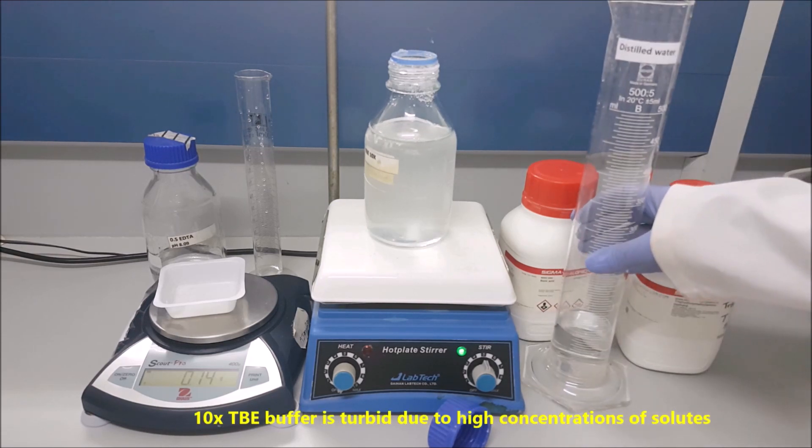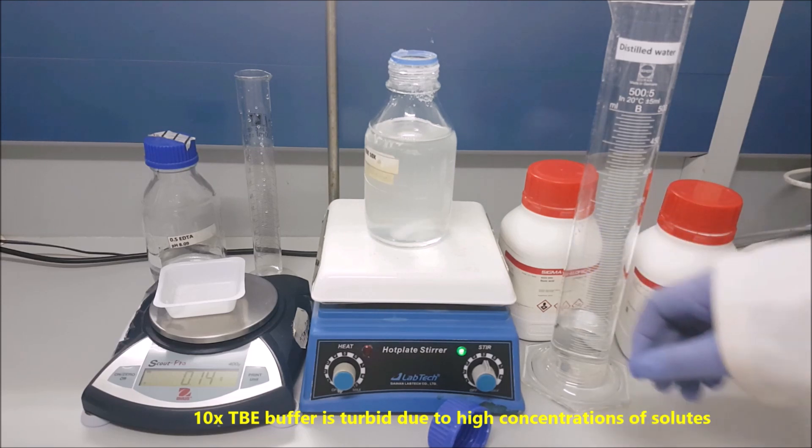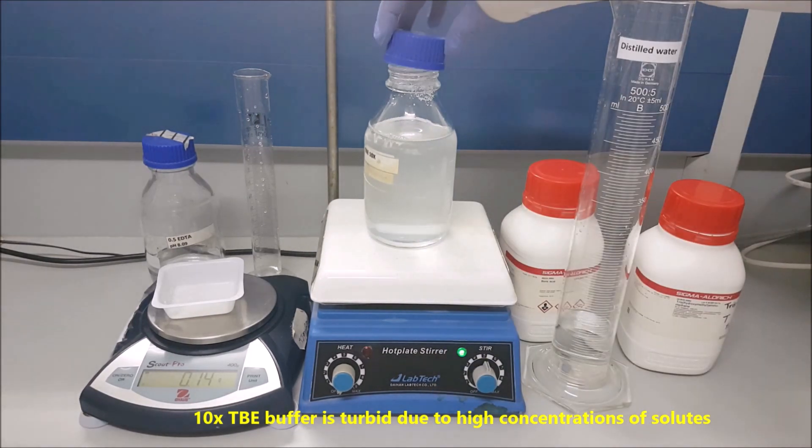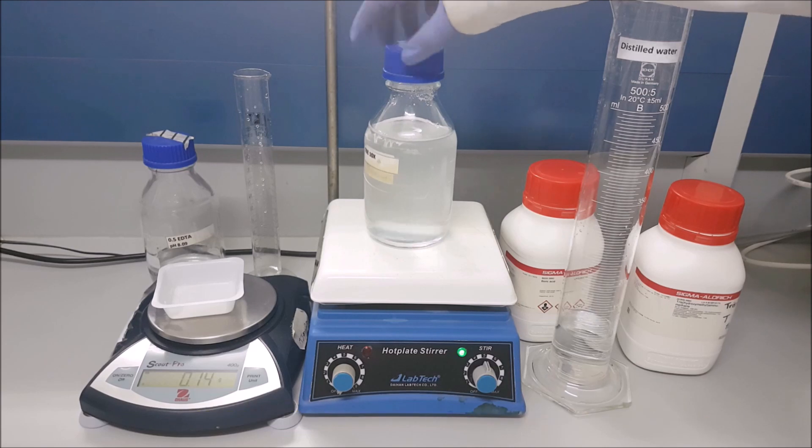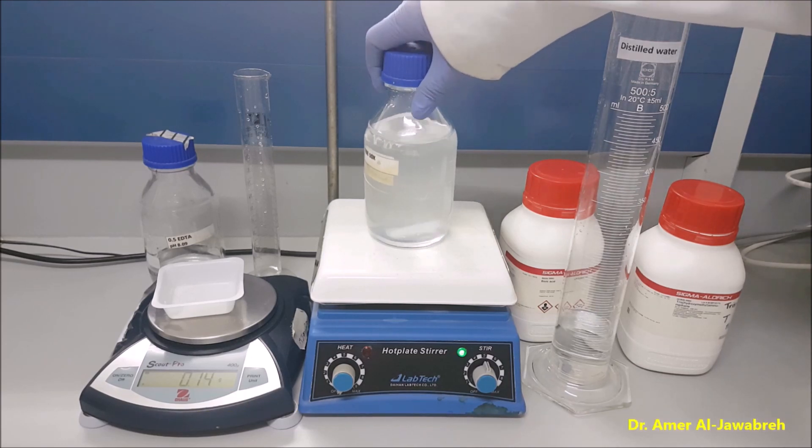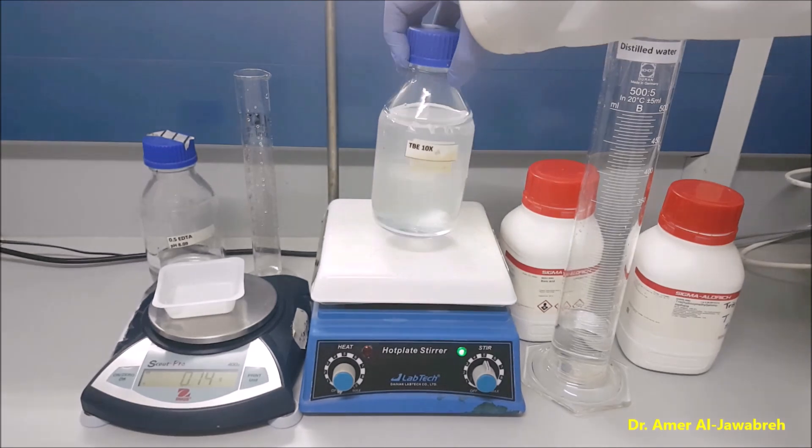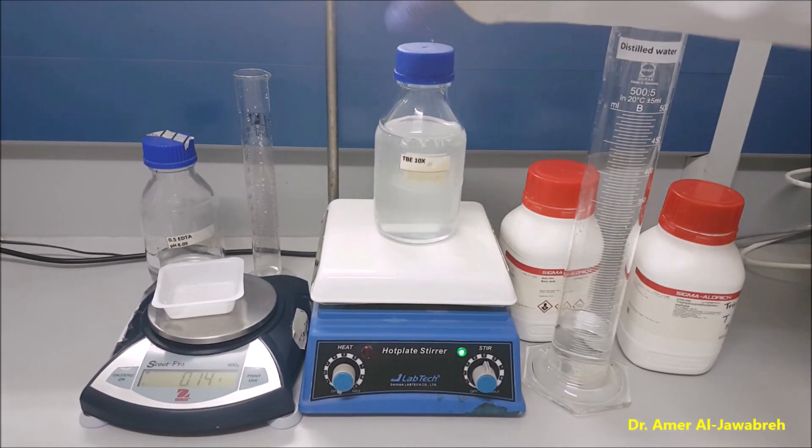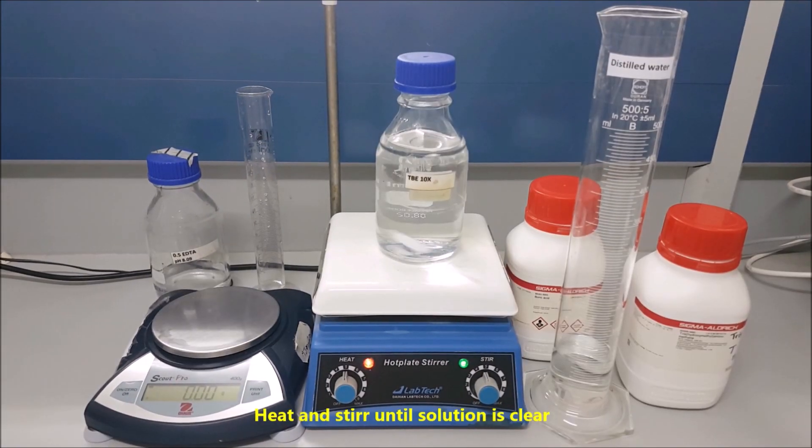10x TBE buffer is turbid due to high concentrations of solutes. Heat and stir until solution is clear.